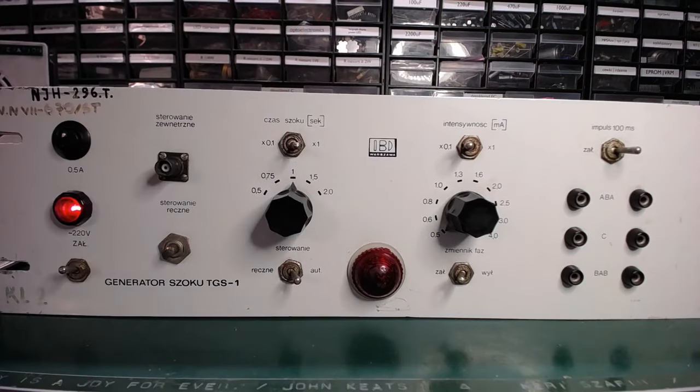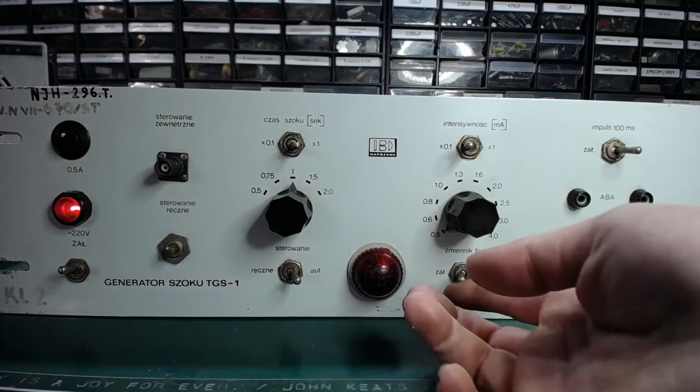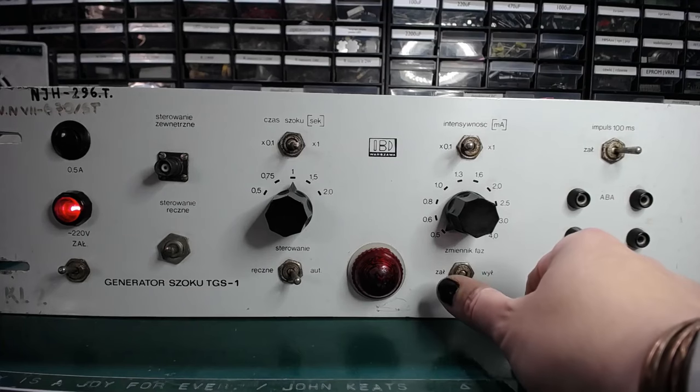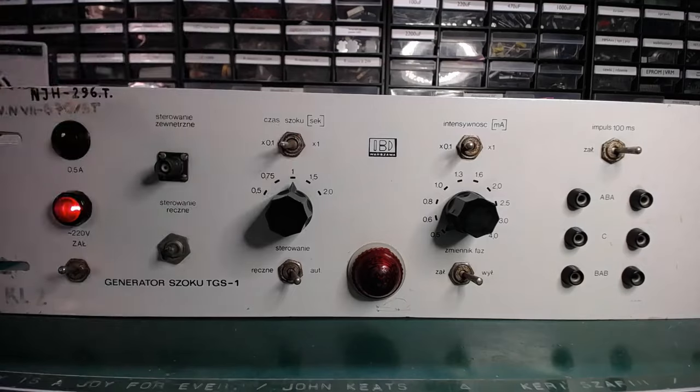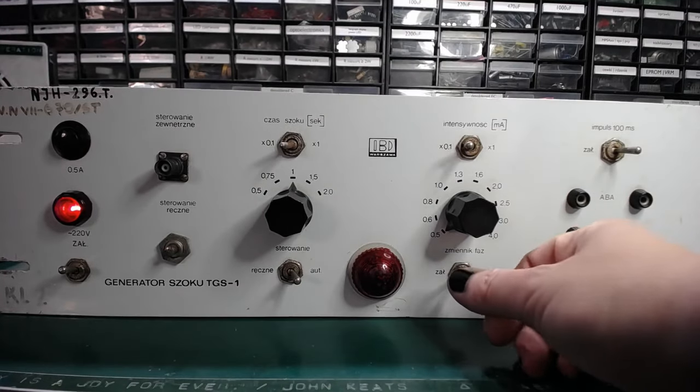The device turns on the motor if it is to be used, and doesn't start and stop the motor for the time of shock, because it would just take too long to start and stop. But the motor can be put out of action with this switch. This is the phase shifter, this is marked phase shifter. If I turn it off, the motor is off. Now it's on.